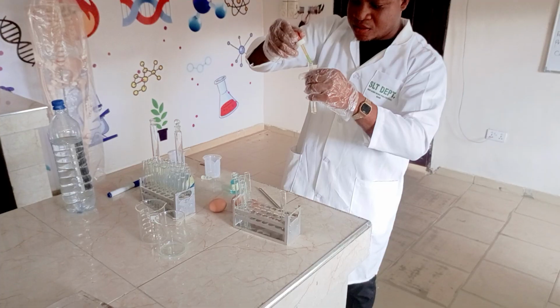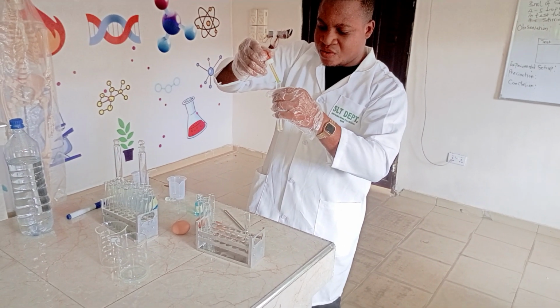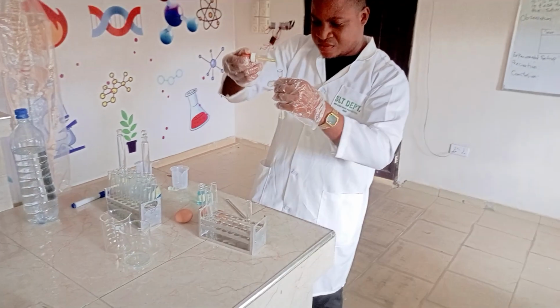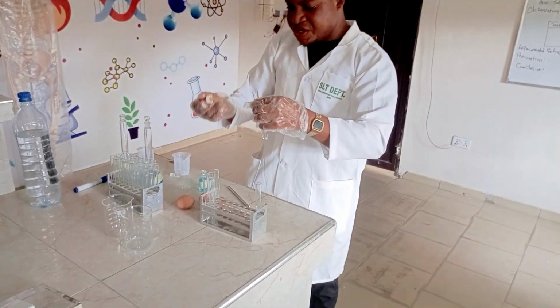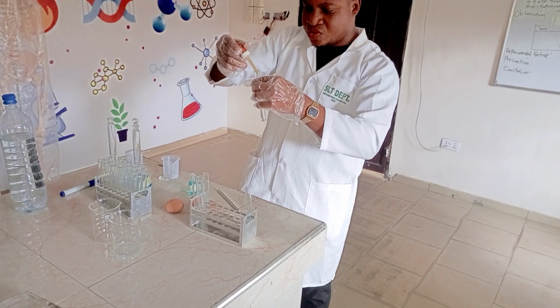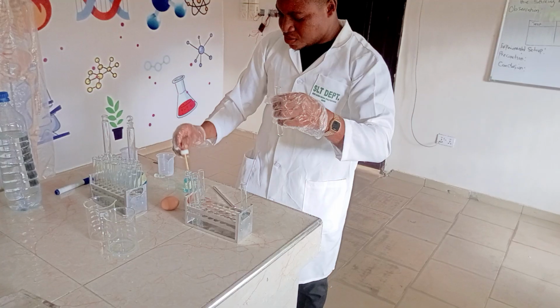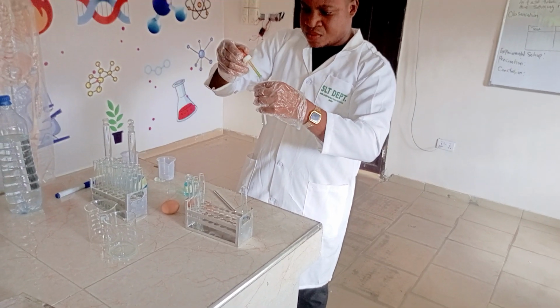This is 1, 2, 3, 4, 5. To test tube B, I will also add 5. 1, 2, 3, 4.